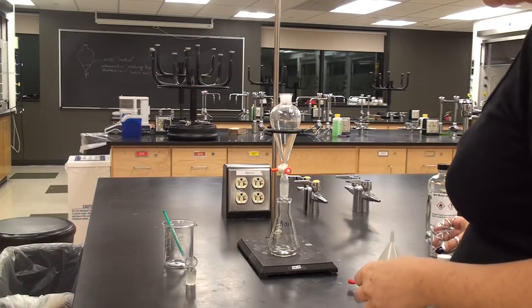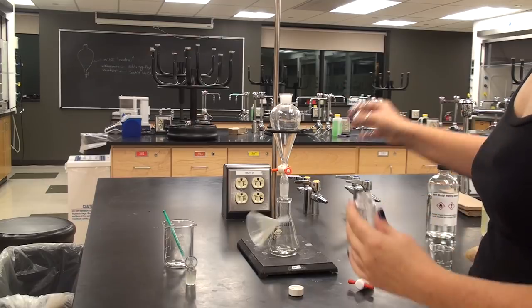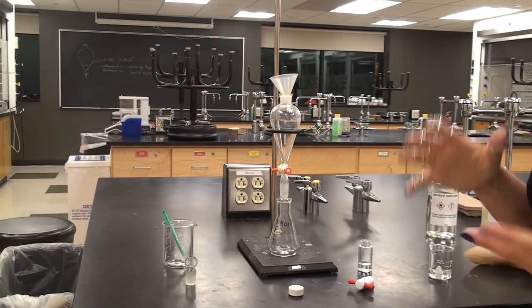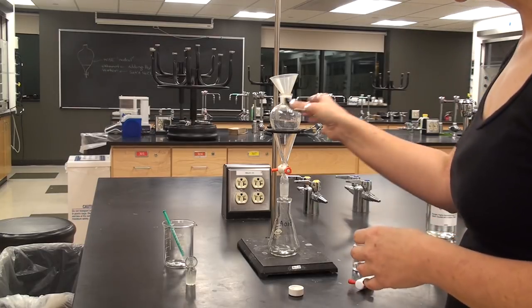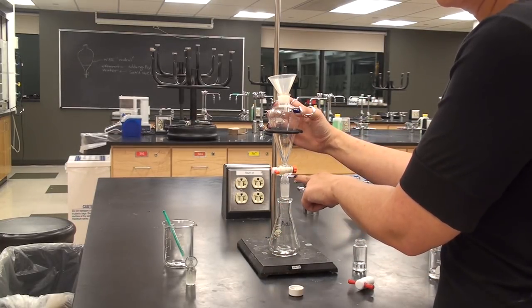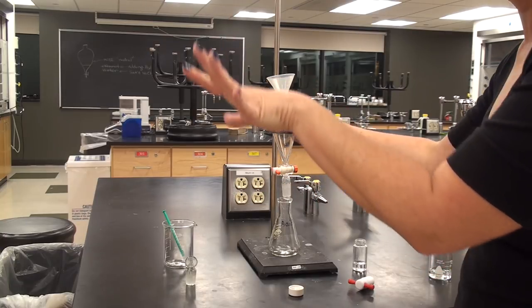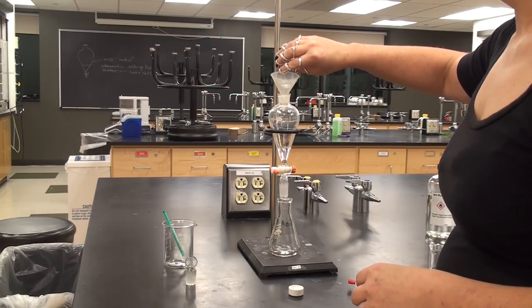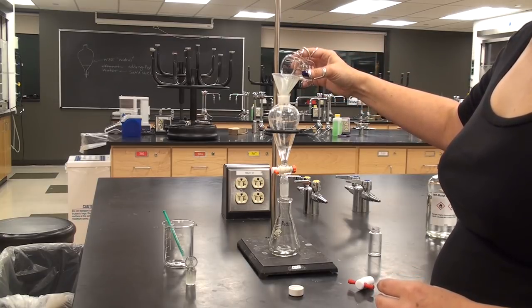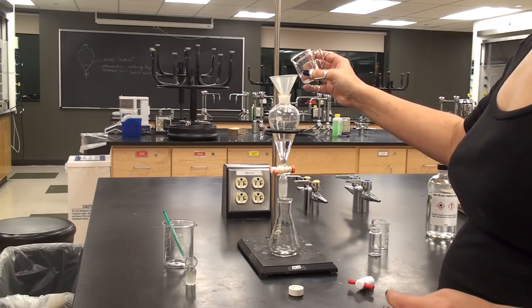As instructed in lab, pour your unknown into your separatory funnel using a plastic funnel on top to avoid spills. Make sure your stopcock is closed, and always have a container underneath the sep funnel — the last thing you want is to find the stopcock was open and the solution goes all over the bench. Now add about 15 milliliters of methyl tert-butyl ether as the organic solvent — none of these volumes have to be exact, just enough to make the separation work.